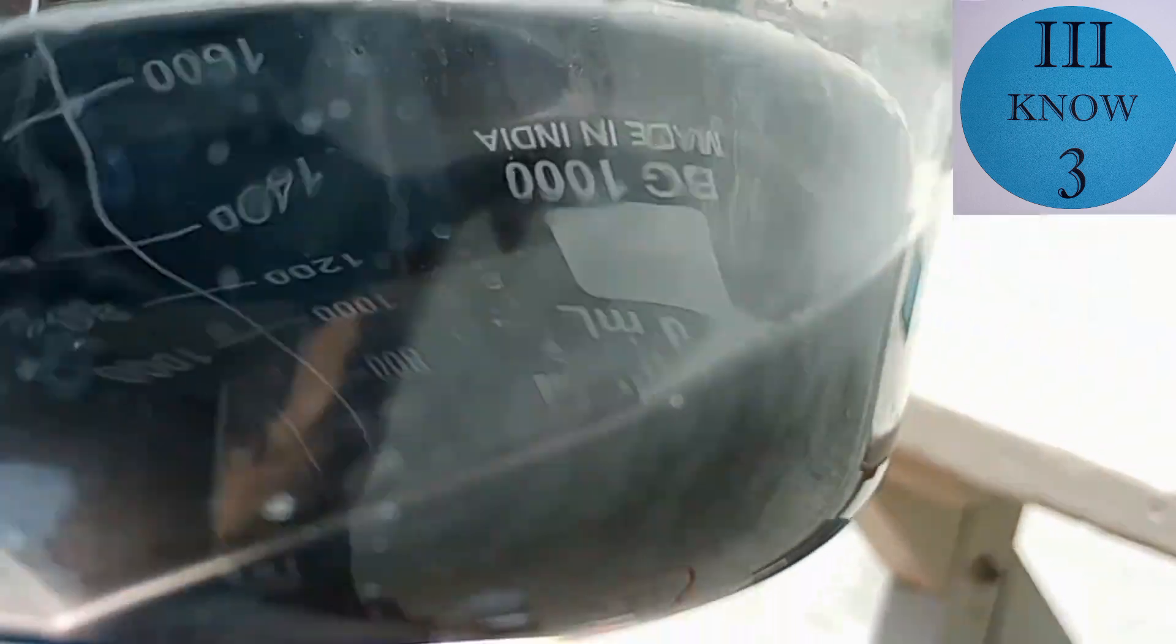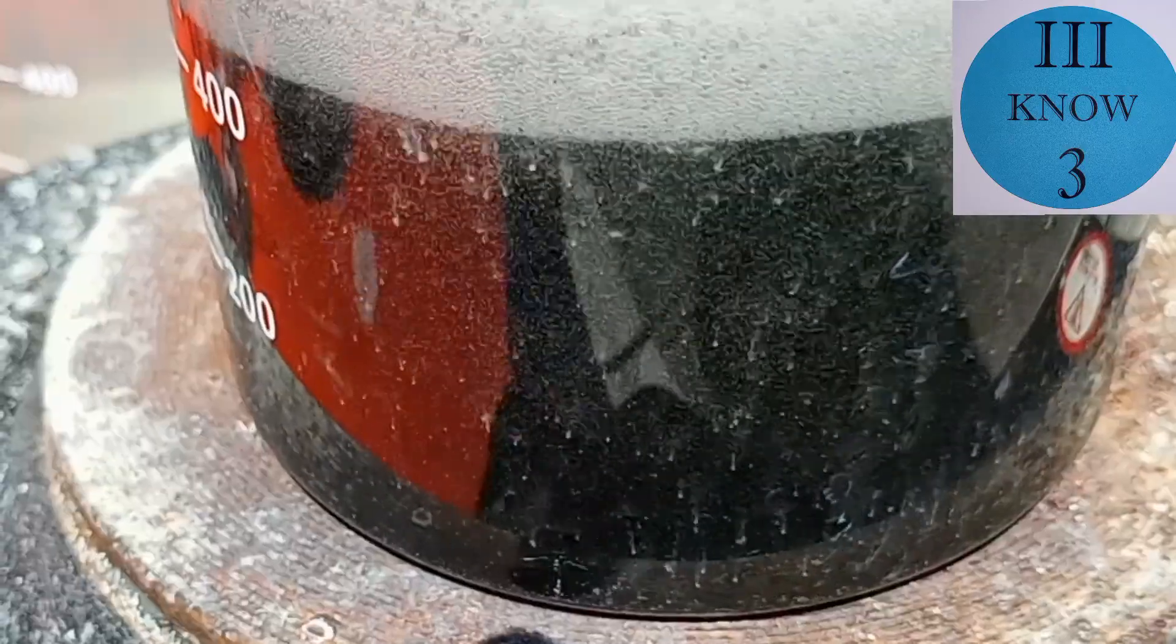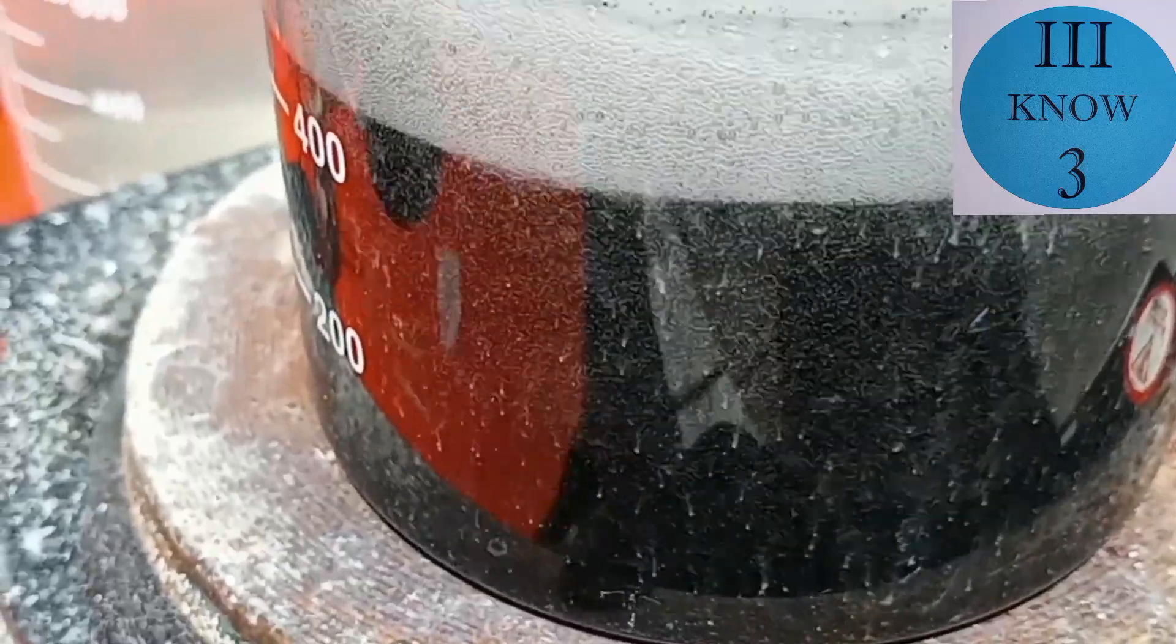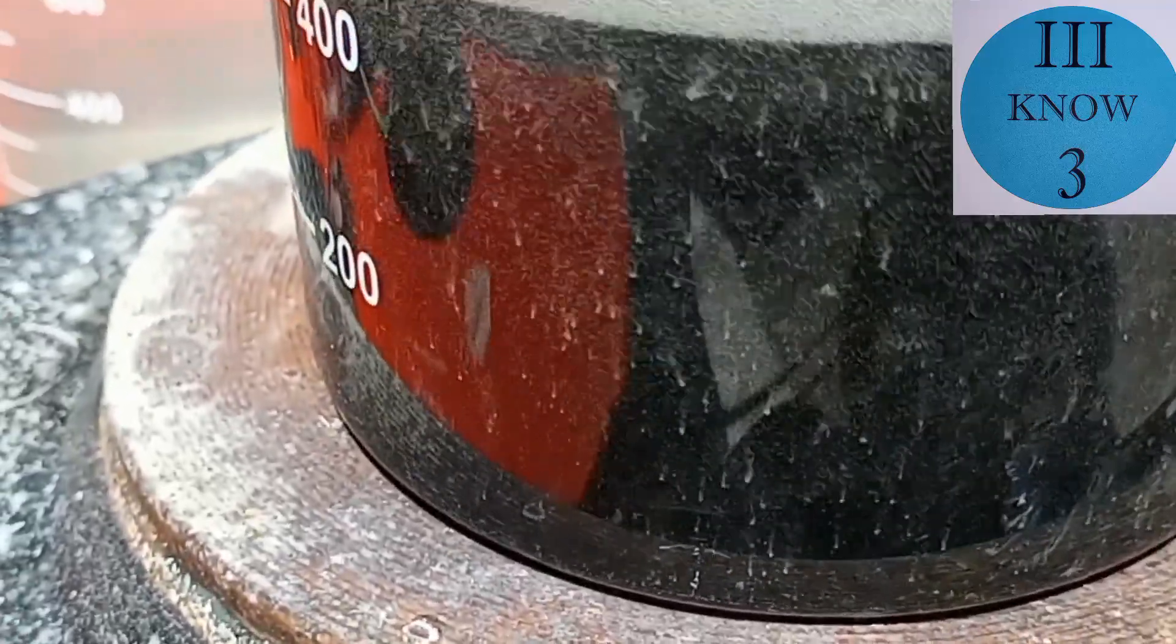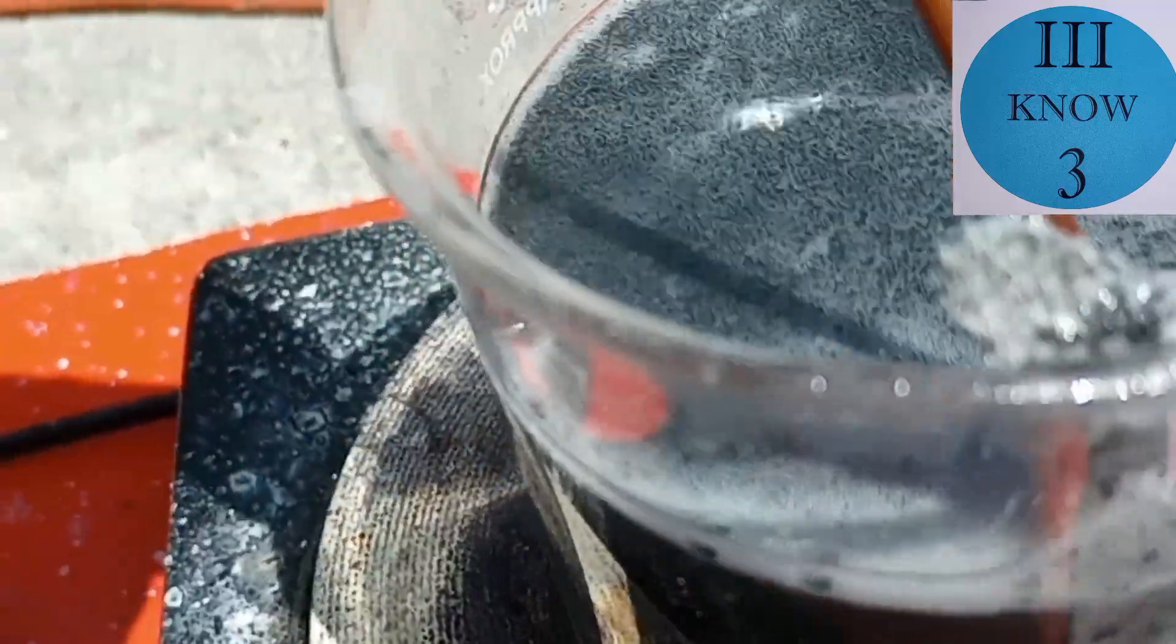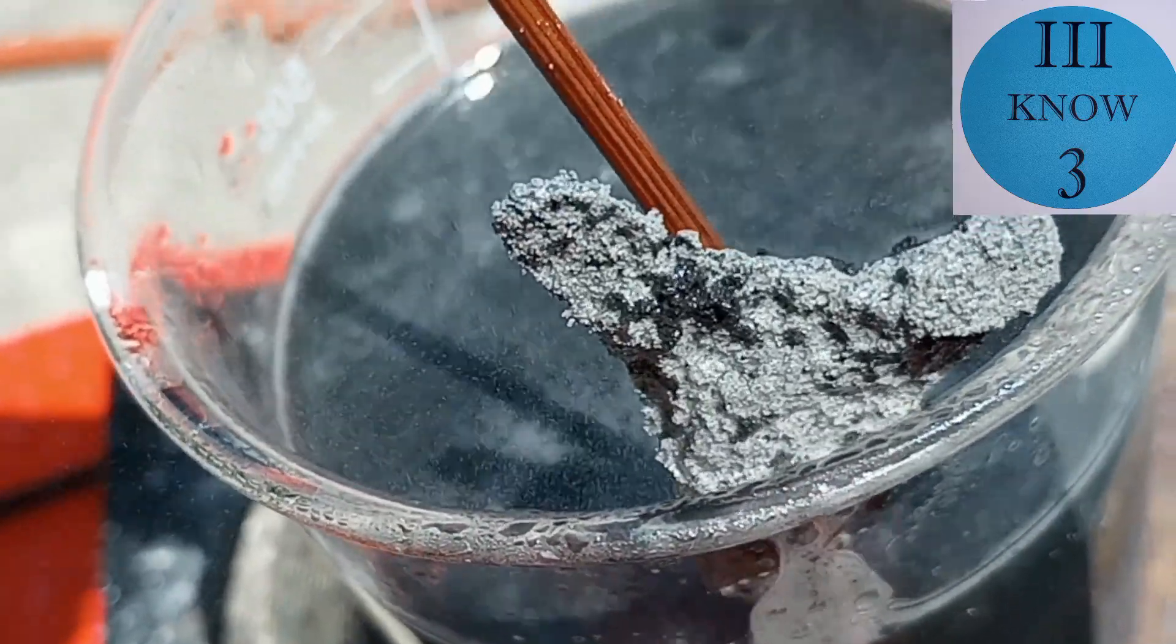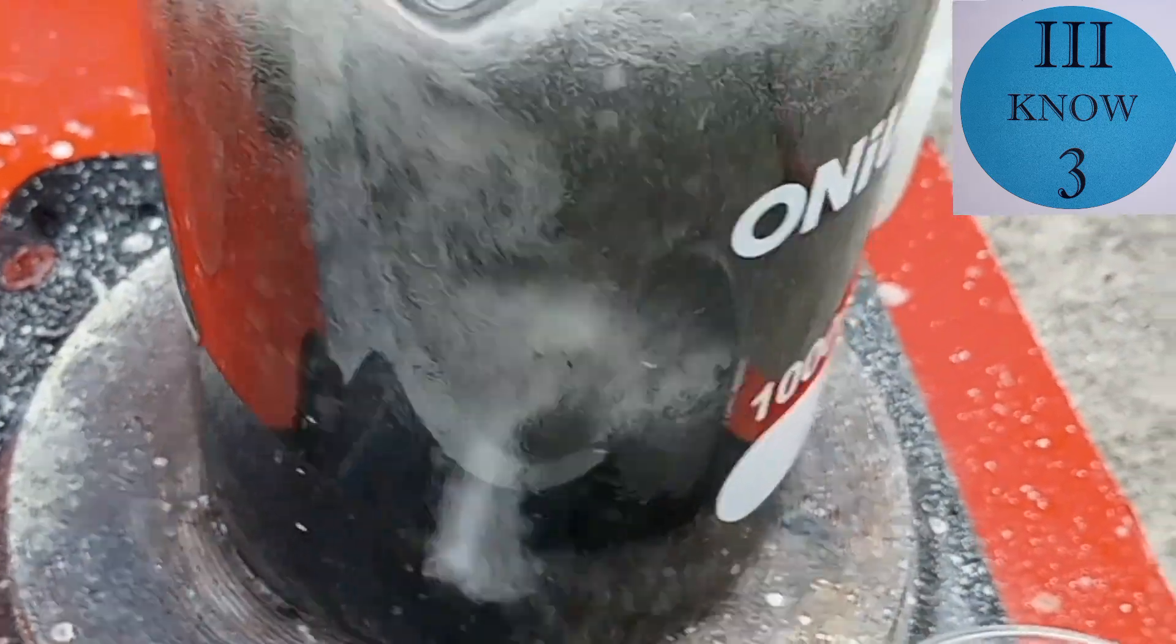I thought that this big piece of aluminum would have enough mass to displace any of the nickel that was remaining in the solution. Here you can see that the piece of aluminum appears to be nickel plated and the solution looks dark so I believe a good amount of nickel precipitated from the solution but I'm going to continue this a little bit longer. If you're thinking that aluminum foil or powdered aluminum might have been faster well you're right but this piece of aluminum was from a can melt that I did and I don't really have any use for it at the moment.